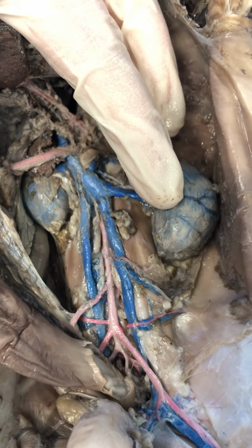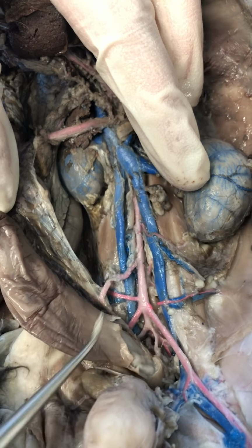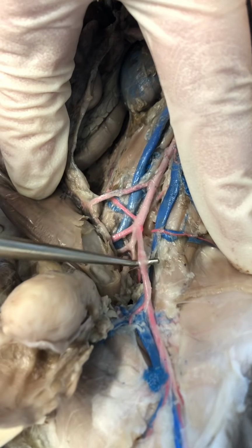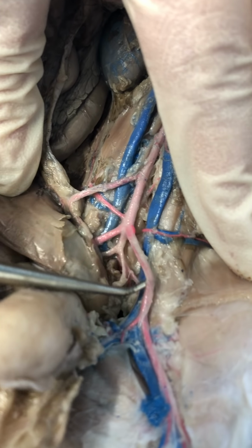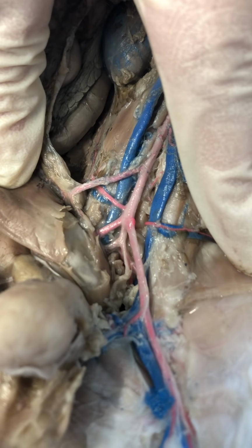It just got ripped on this side. So then below my gonadal will be my inferior mesenteric artery. So then below that we get into the iliacs. So for the arteries, we have a big outer V, and then we have a smaller inner V on the inside. So this outer V structure is my external iliac. The smaller inner V is my internal iliac.